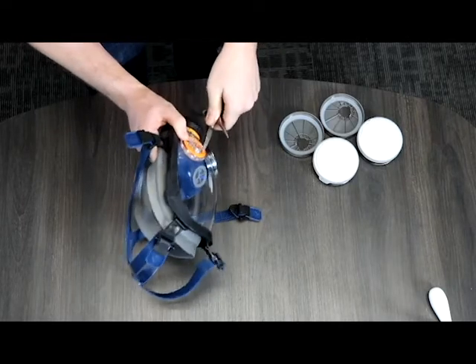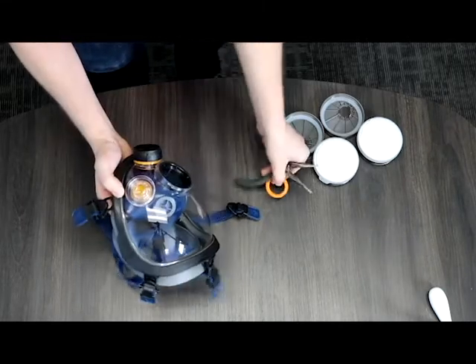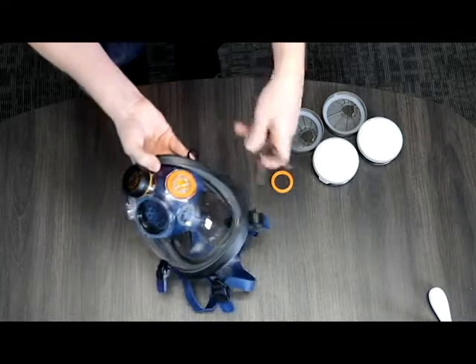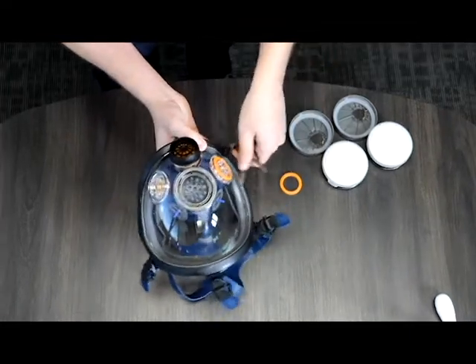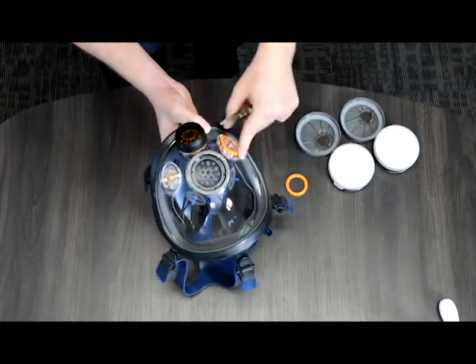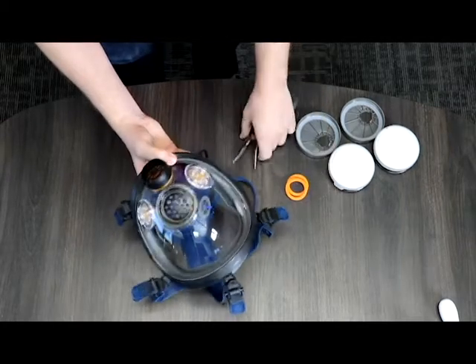Then we move on to the o-ring, the first set of seals. Just take a flathead screwdriver or a set of pliers and just go right underneath and pop it right open.